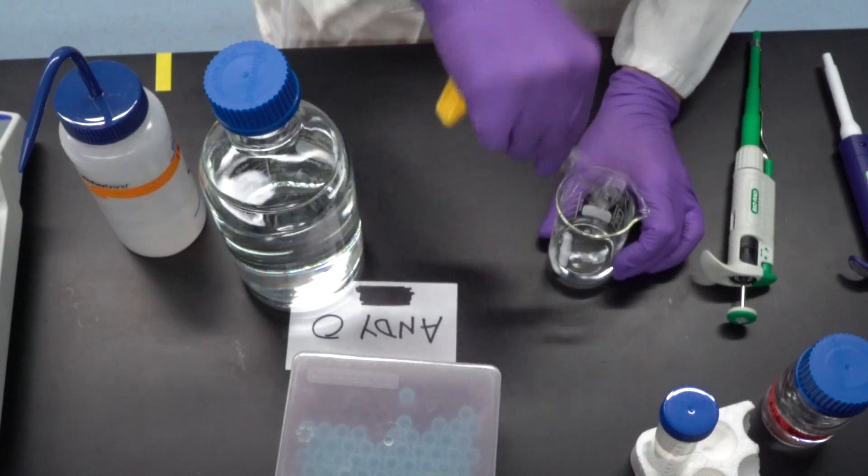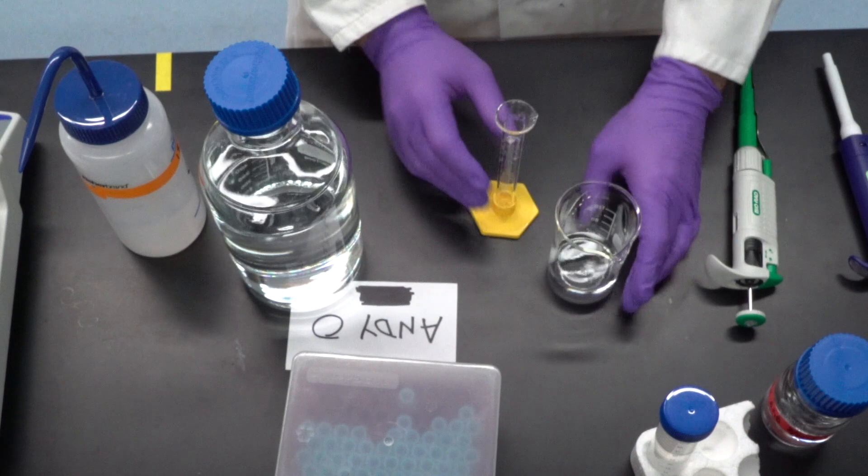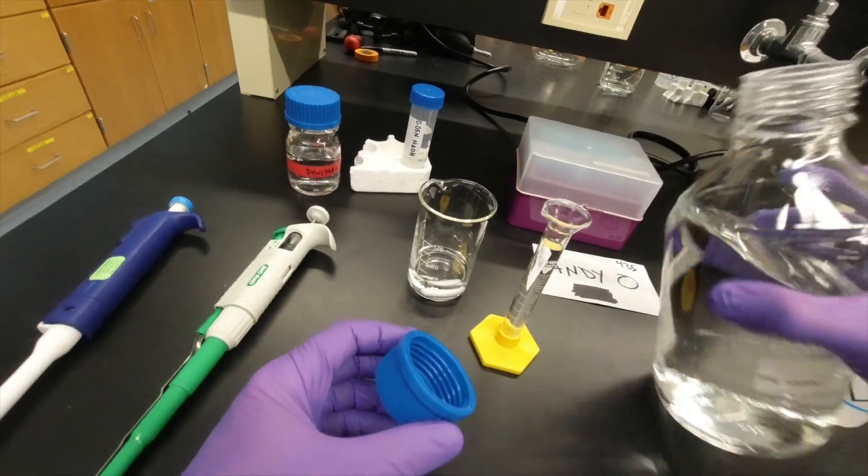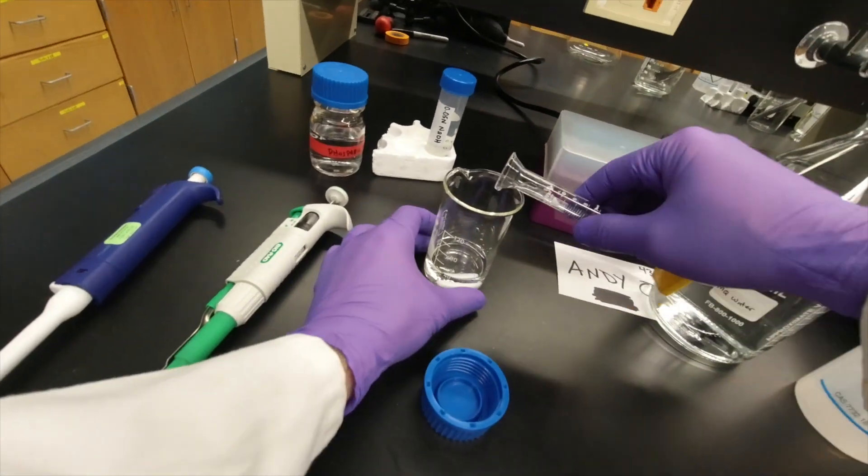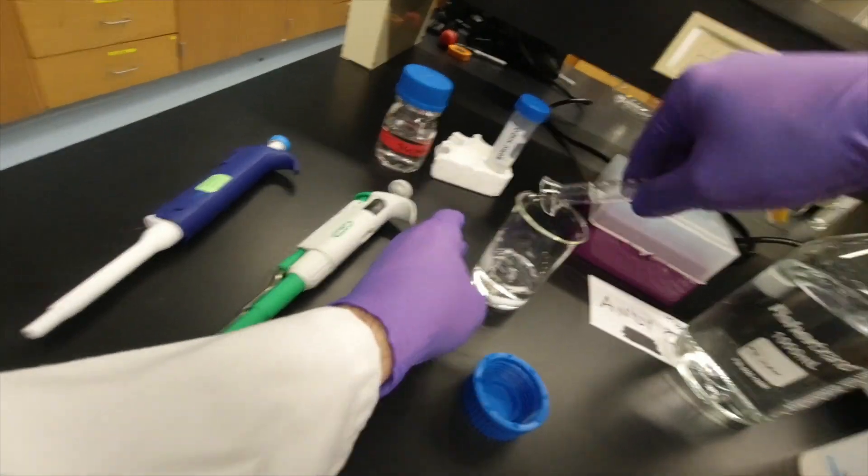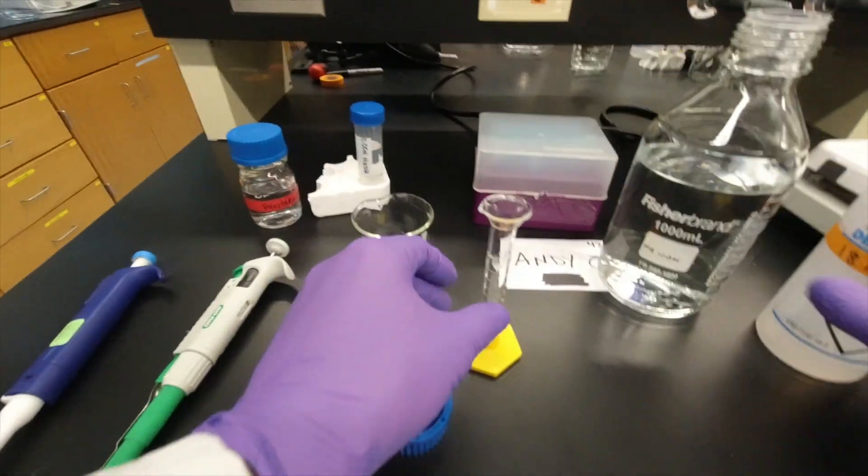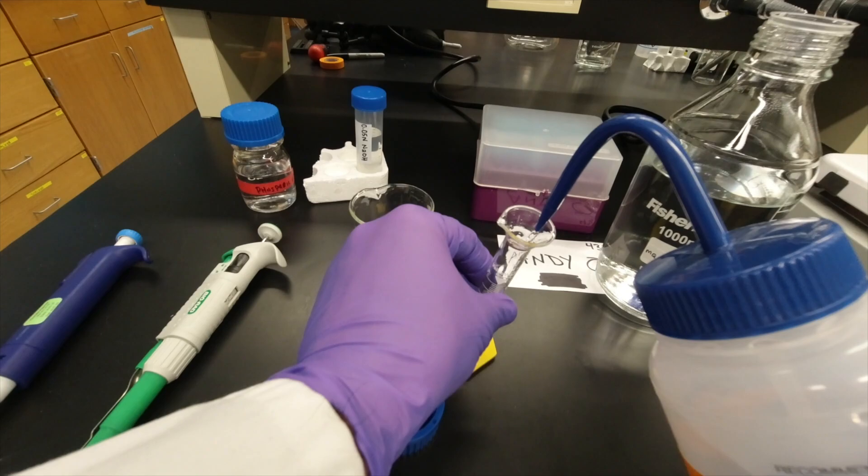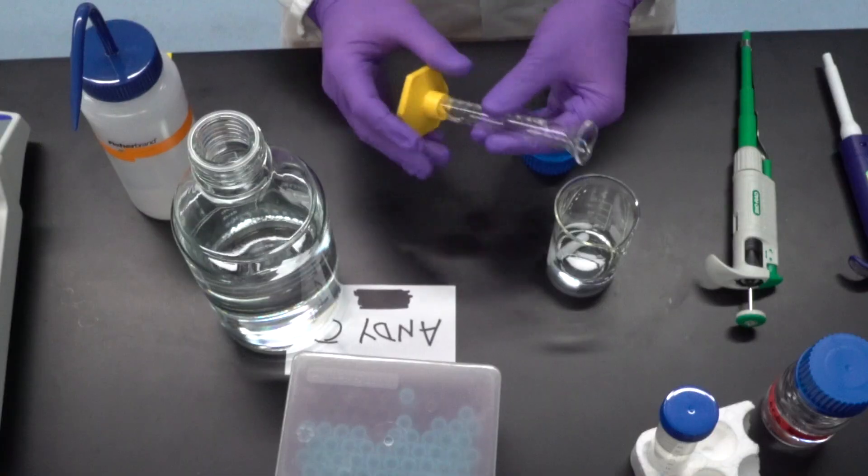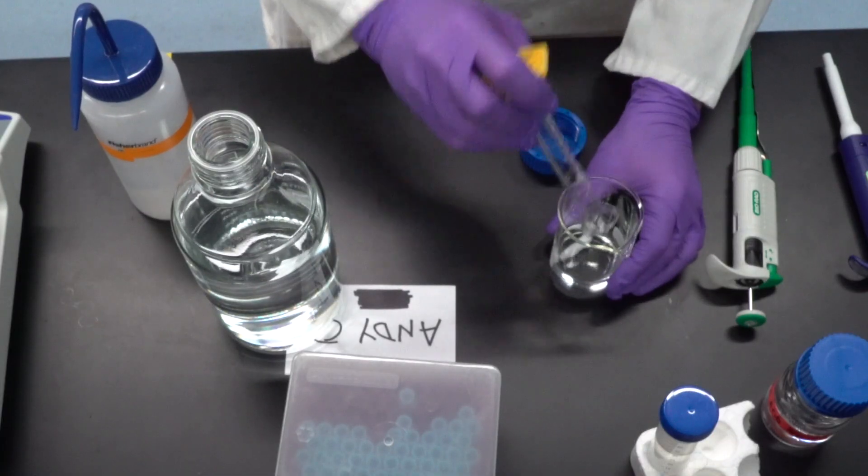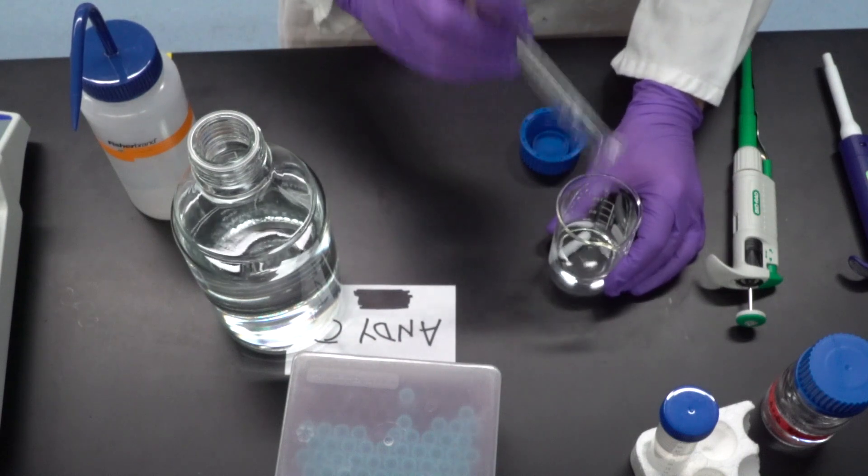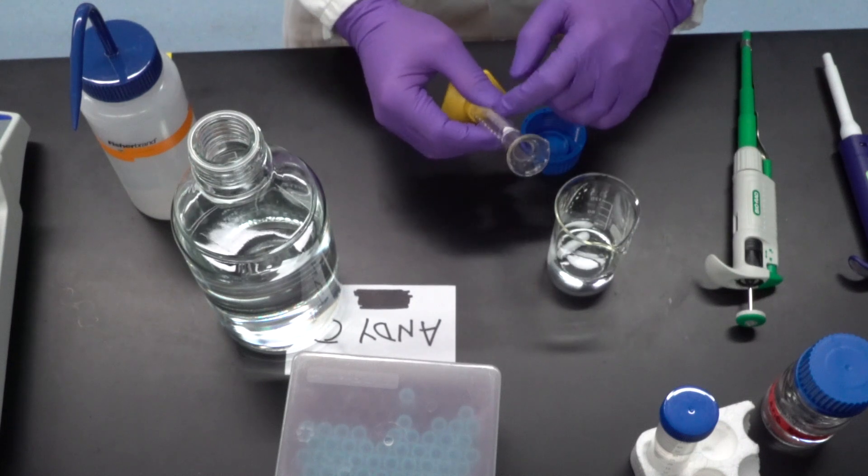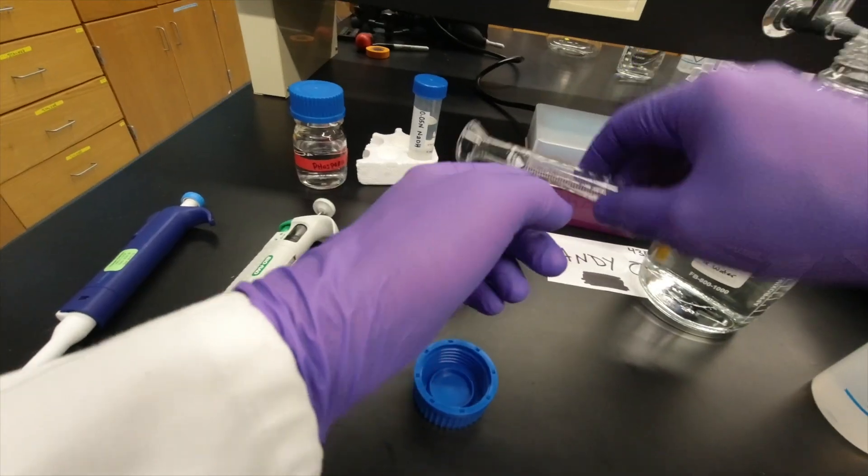43, 44. And if you just want to make sure a little bit more, you can rinse like this. And so the goal is to get every bit of that out. So this should be just water. I rinsed this at least three times to get all of the contents in there.